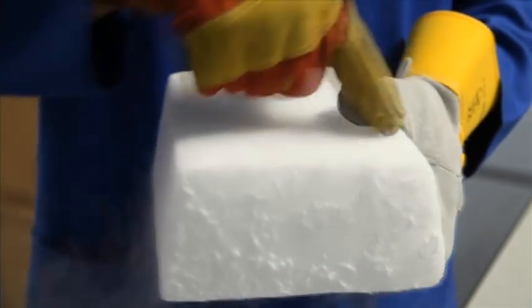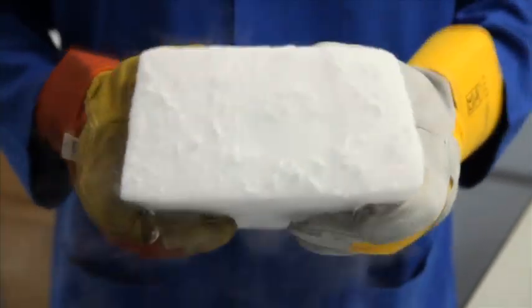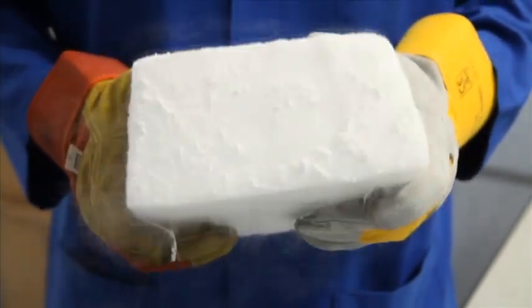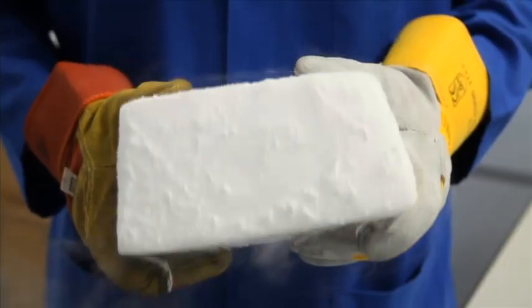Cut off a lid with an inch or so to play with, and then chisel out a cavity into the body. Again, go easy with it because you'll likely fracture the block if you hit at it with a chisel rather than scraping it.